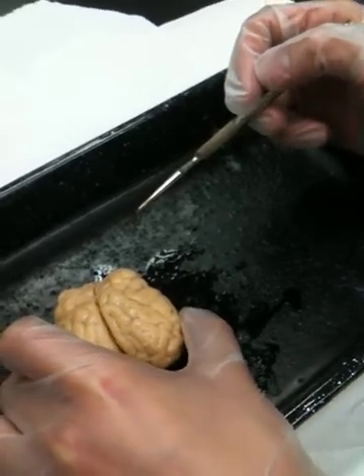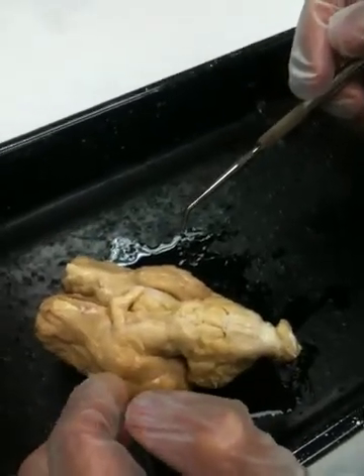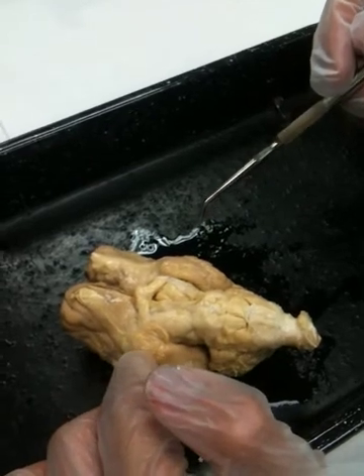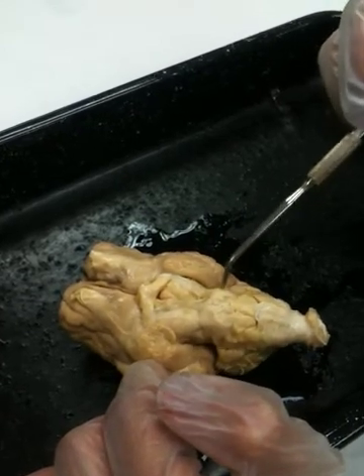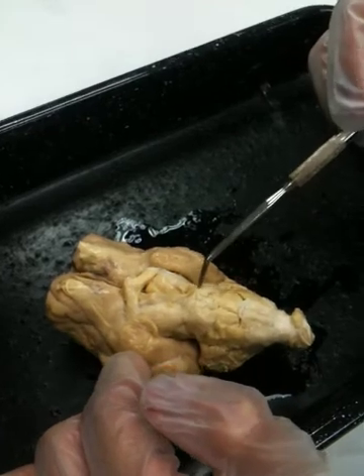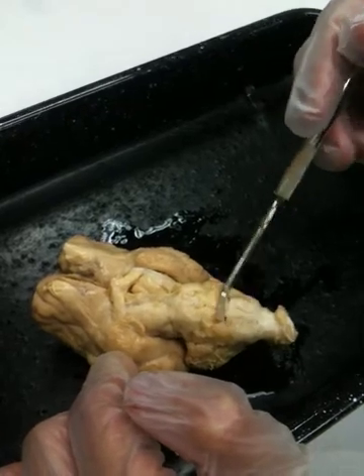I'm going to flip the brain over so that we can see those structures on the lower portion. Looking at an inferior view of the sheep's brain right now. The pons at this moment is partially covered by this flap of tissue, but these enlargements right here would be the region of the pons. And just behind it, this other enlargement area until it turns into the spinal cord and continues on out, this region would be the medulla oblongata. Medulla oblongata.